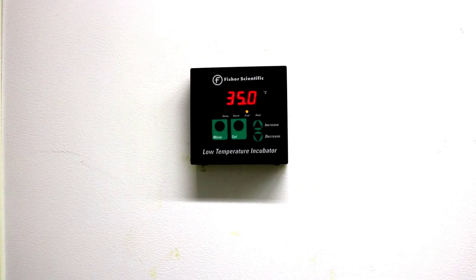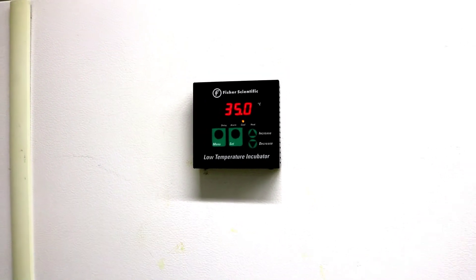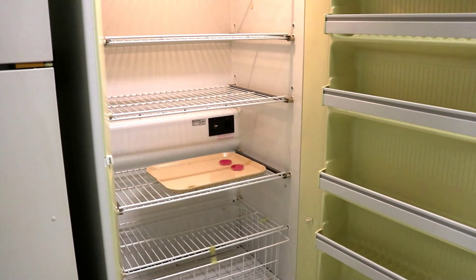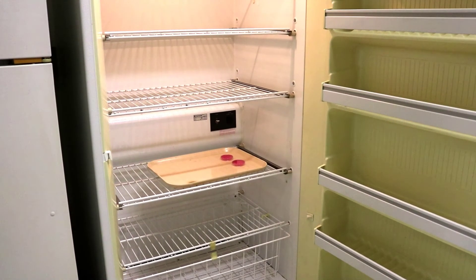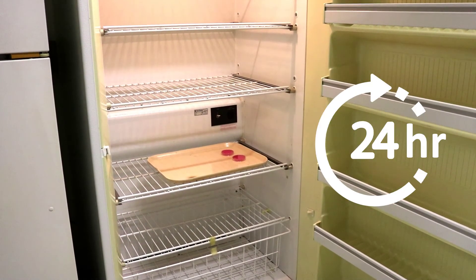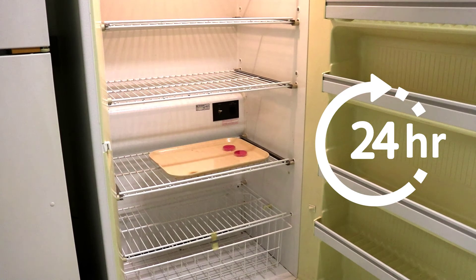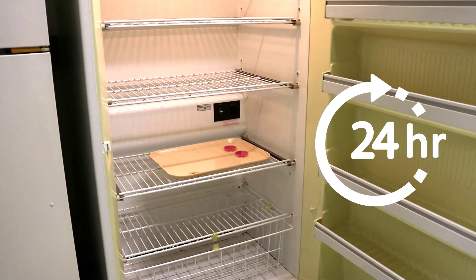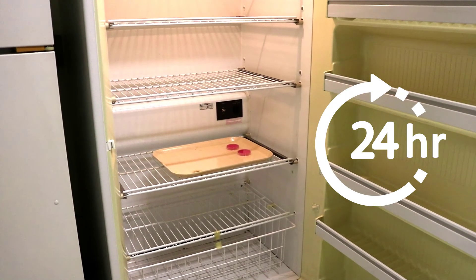Put all plates upside down in a tray and transfer them to a 35 degrees Celsius incubator to cultivate them for 24 hours. The cells will grow into colonies as they feed on the agar over the 24-hour period.